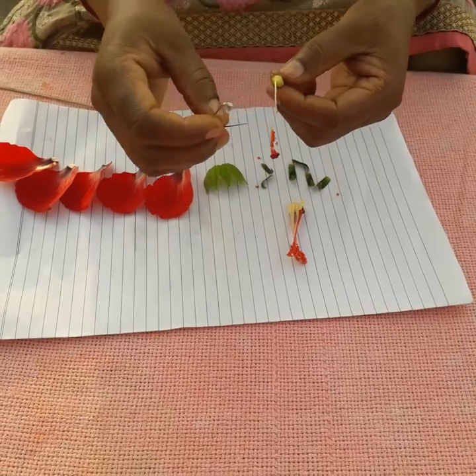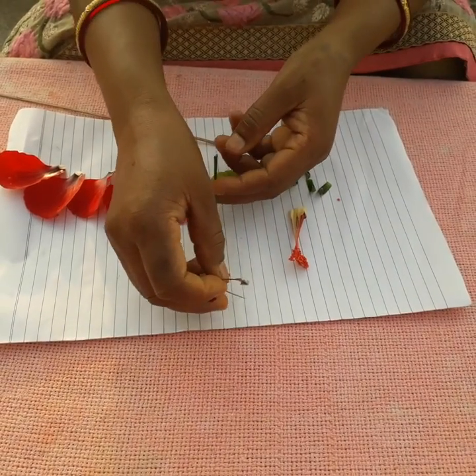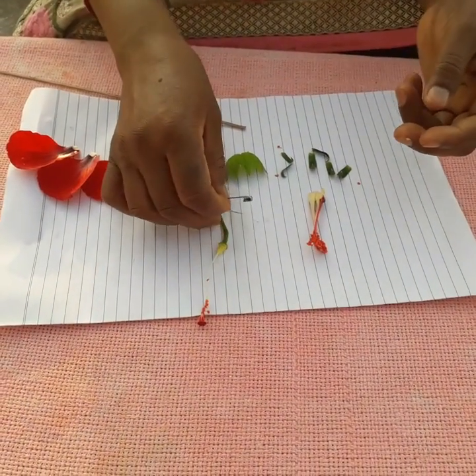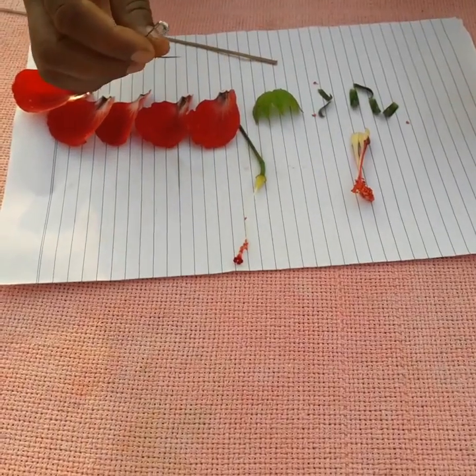So altogether it is known as gynoecium. So we have completed the demonstration of the flower.